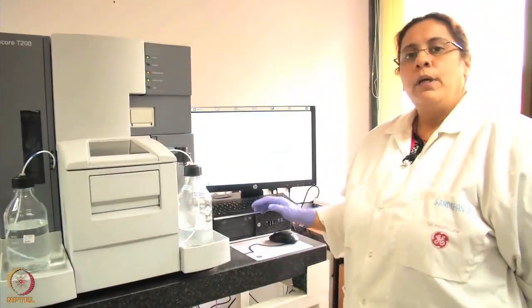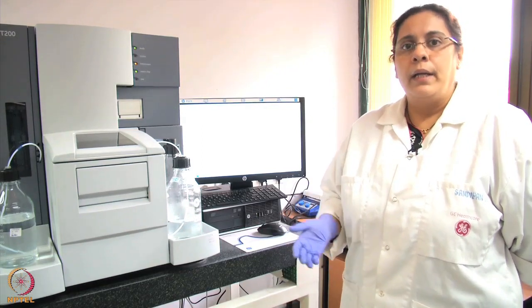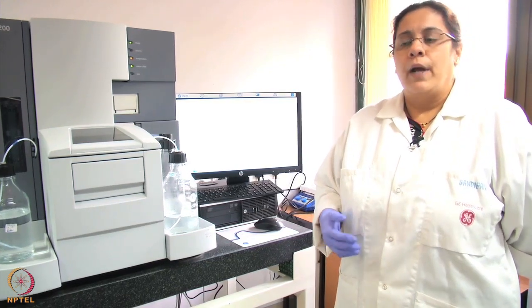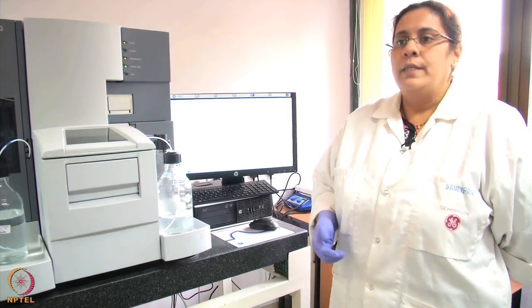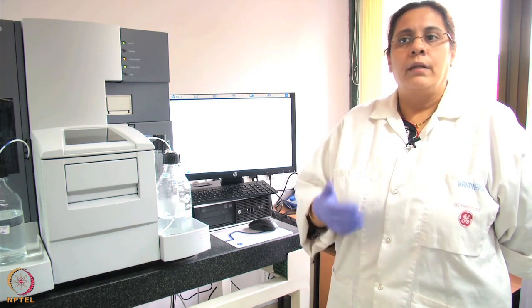Let me also show you a kinetics experiment, which gives much more information than the basic yes-or-no binding experiment. In a kinetics experiment, you can find out the association constants, dissociation constants, and affinity constants. You use a concentration range of analytes passed over your ligands and calculate the various constants based on the sensorgram curves.